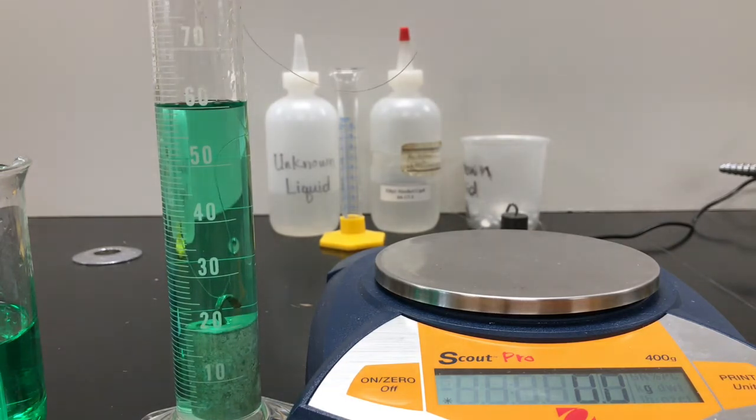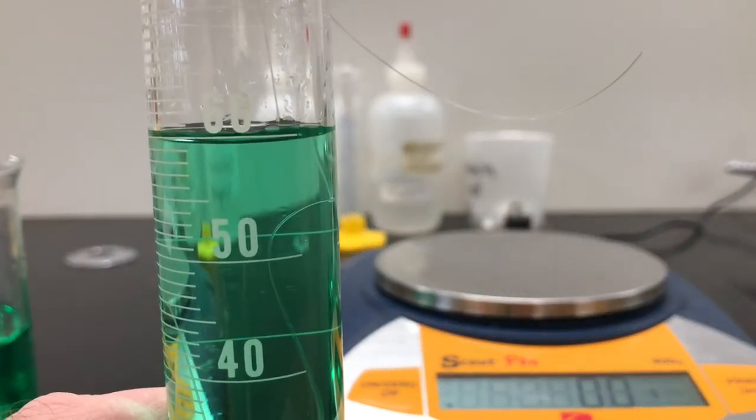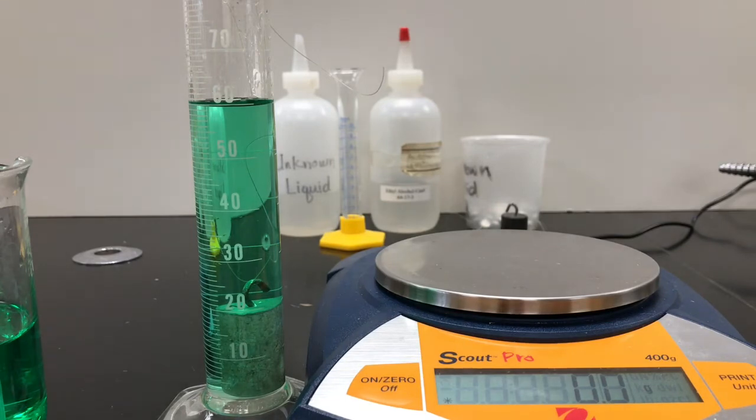And there, oh, we are right under 60, aren't we? So let's get a little closer look at that. I mean, it's not quite 60. It might be like 59.5. It's not 59, it's a little above that. So, you know, here you can guess in between those little lines. So, you know, 60, 59, 59.5. It's a tough call. You're going to have to make that determination.